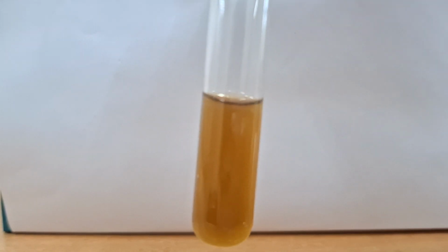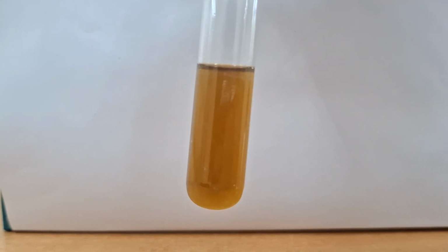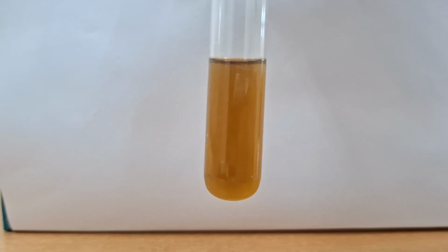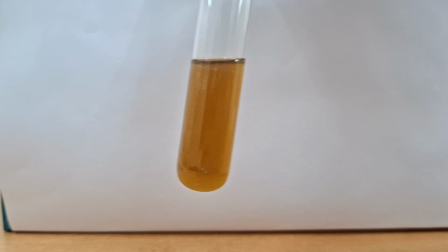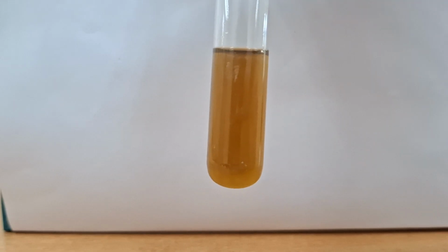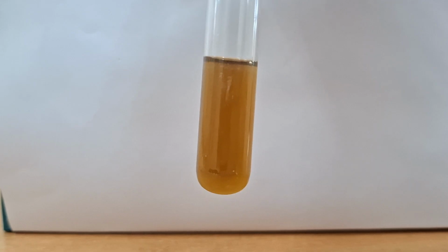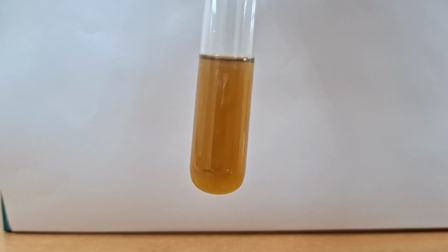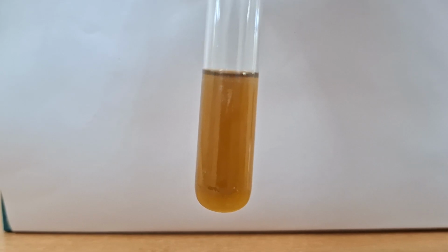So now on the next, we are observing this test. You can see the sulfur test. In this test there is a brownish color tinge, slightly brownish, and sometimes a blackish color precipitate is also seen. This sulfur test is mainly, as the name suggests, for the sulfur containing amino acid, that is cysteine and cystine. Methionine does not give this test.